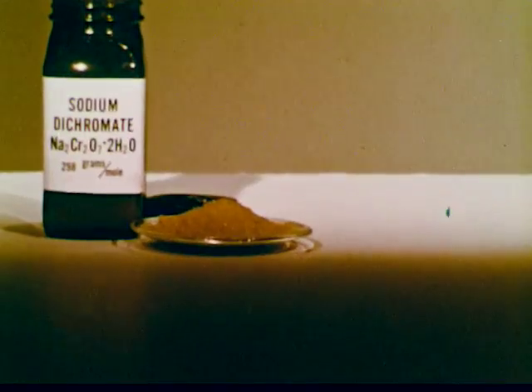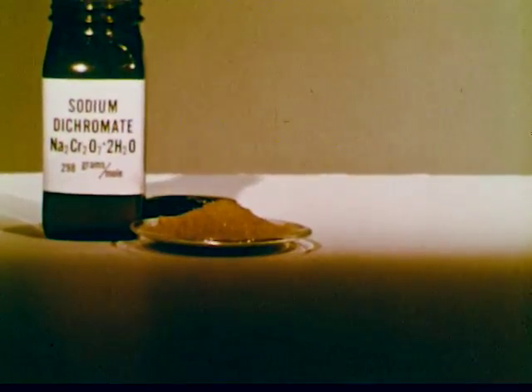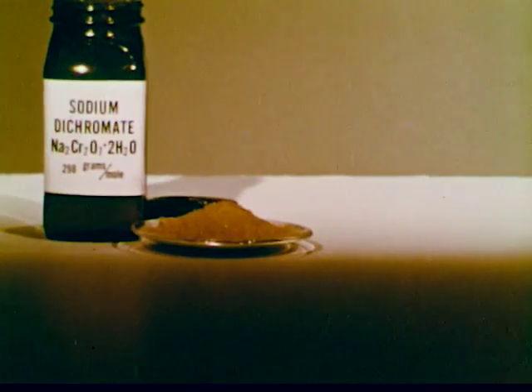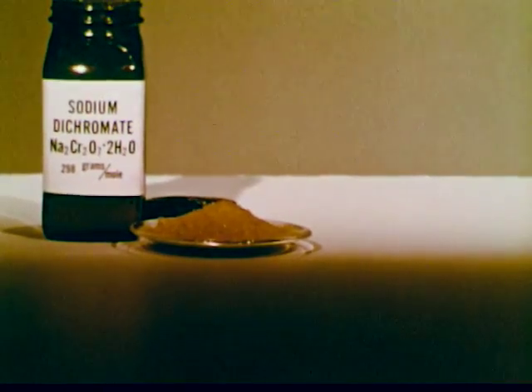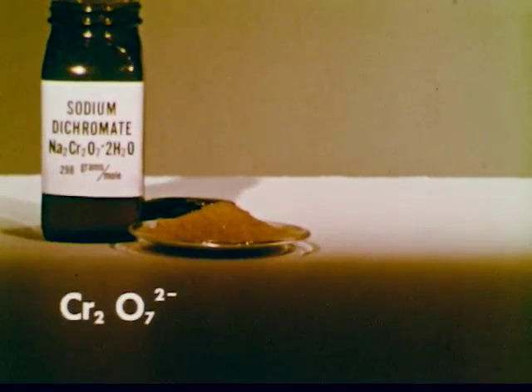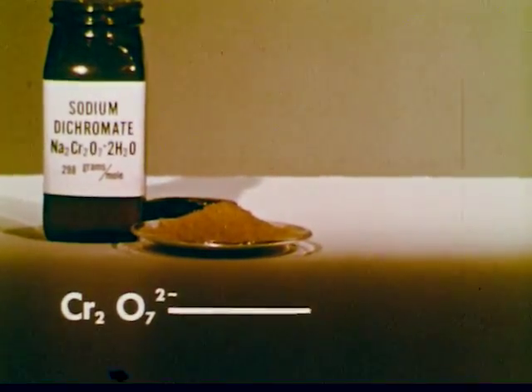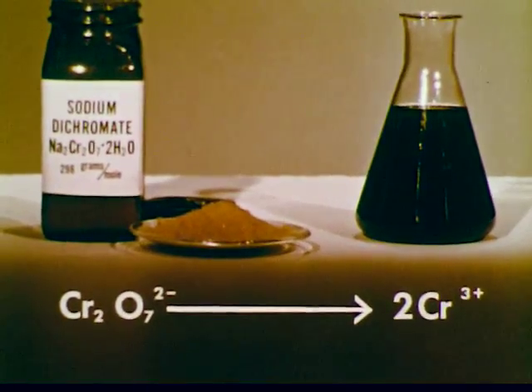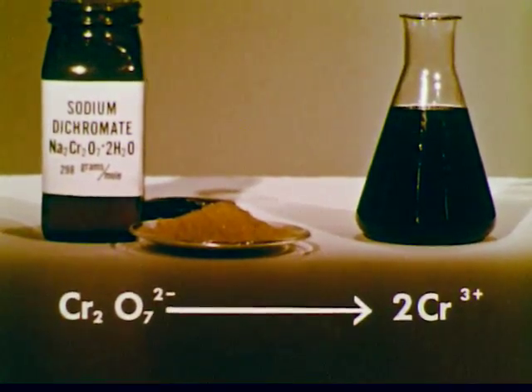Sodium dichromate will be used to oxidize the alcohol. In the reaction, the orange dichromate ion is reduced to the green tri-positive chromic ion.